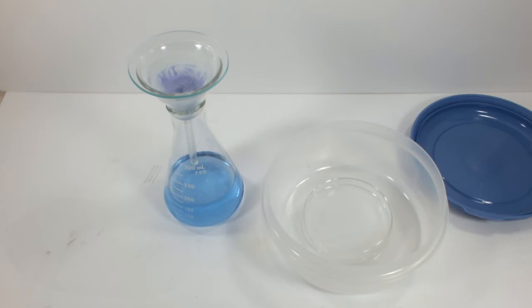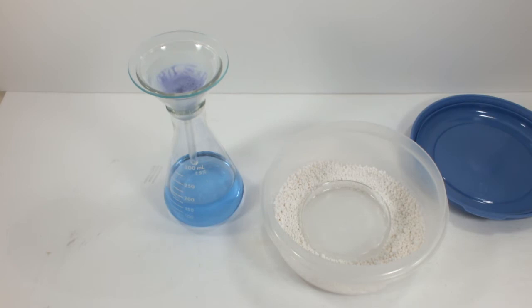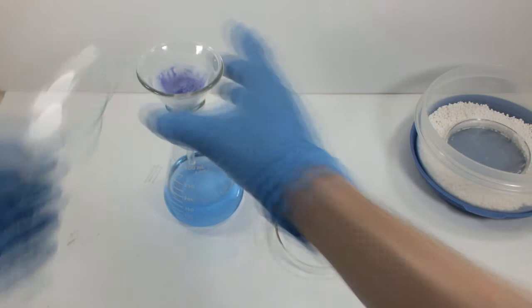But this is the major difference. I'm going to use this dish to build a makeshift desiccator. It all starts with an inverted petri dish in a moat, if you will, of anhydrous calcium chloride to draw out the water from the precipitate. The complex is in the other half of the dish, and that gets put on top.